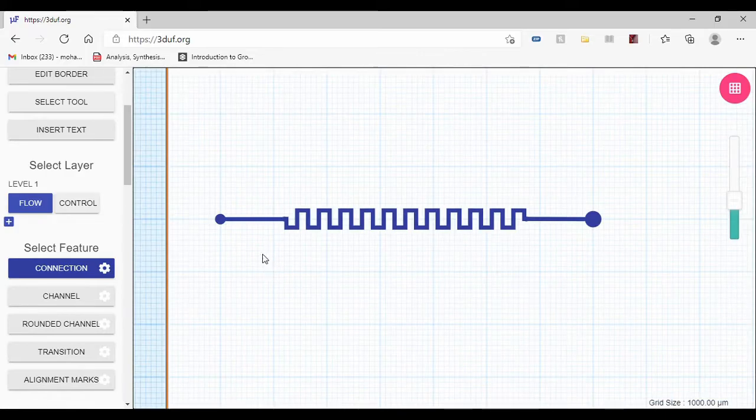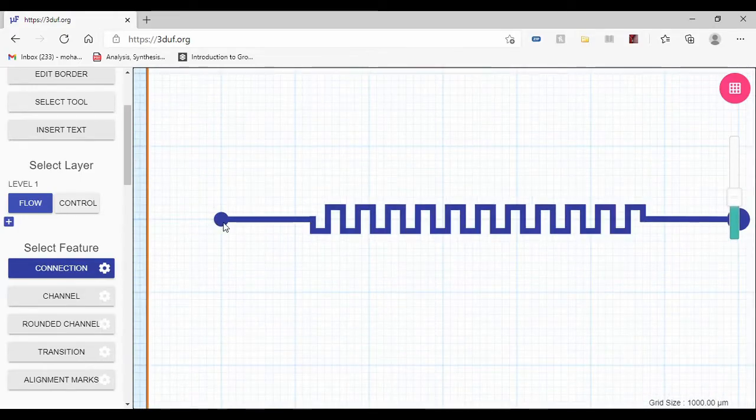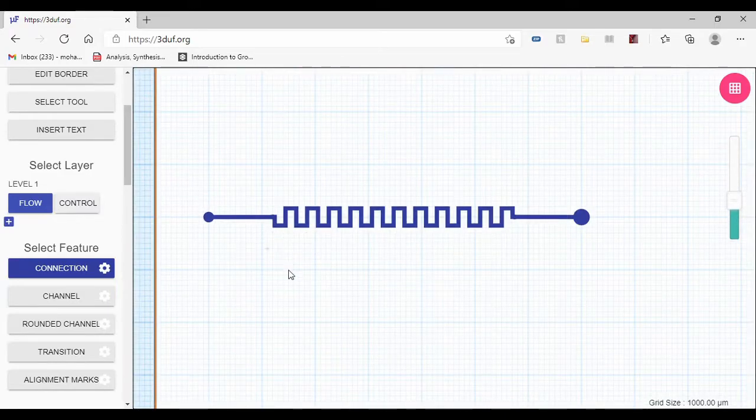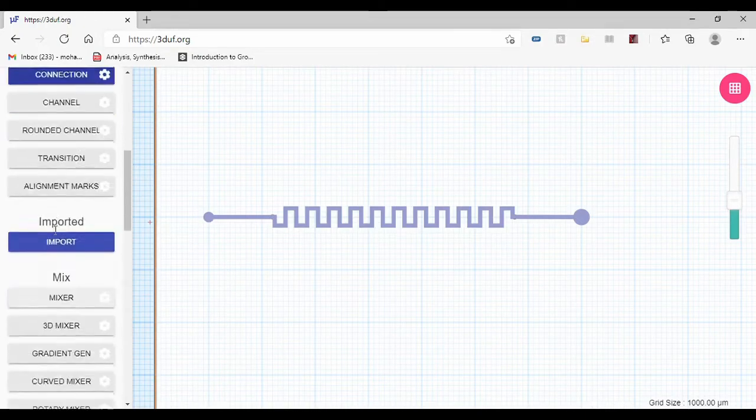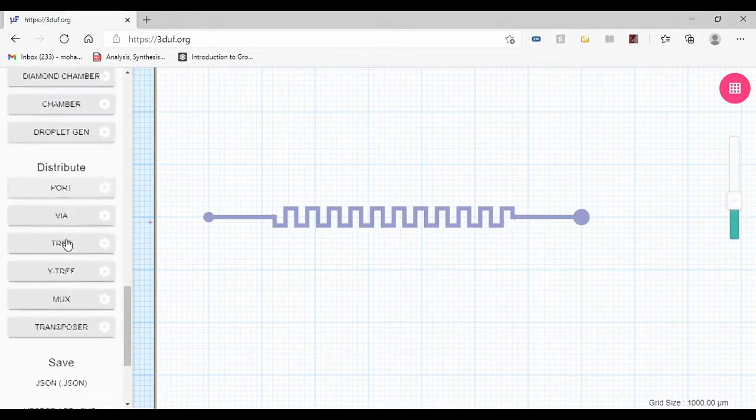All right. So this flow layer will take the fluid collected here, mix it up there, and then it will go to this port right there. What I want to add now is the other layer, the control layer. The control layer is basically where I will have my input and output. I want to make an input that connects me to the flow layer right there. To do that, the first thing I have to do is put a port.